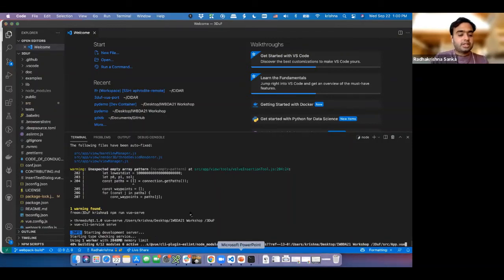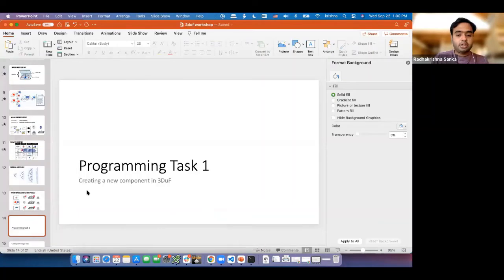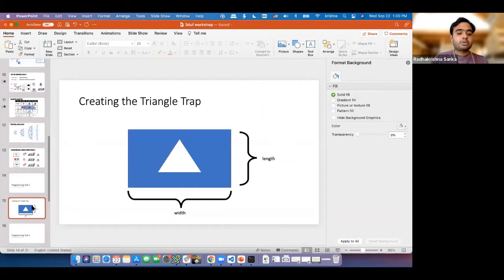Yeah, so as I was saying, going back into our slide deck. The first programming task which we're doing is to add a new component, which I'm just going to call the triangle trap. It's a fairly easy component. It's a rectangle with a triangular hole in the middle, and that's what it is. And the 2 big parameters associated with it are length and width.